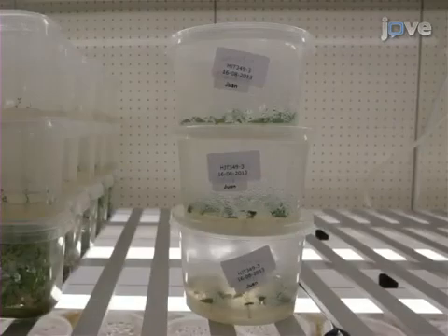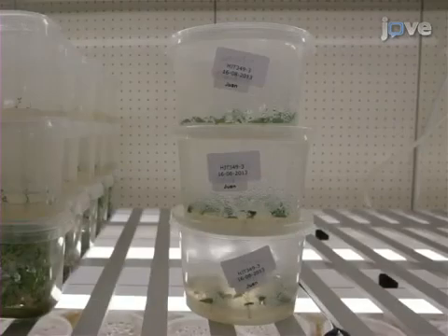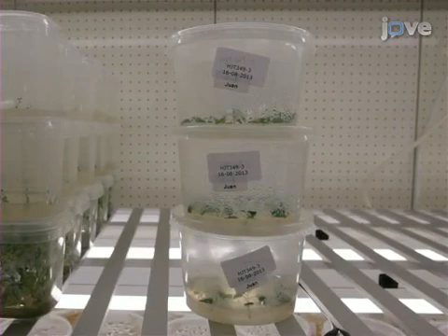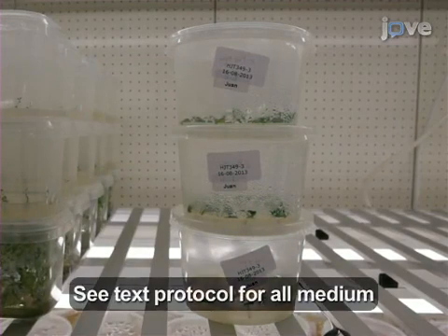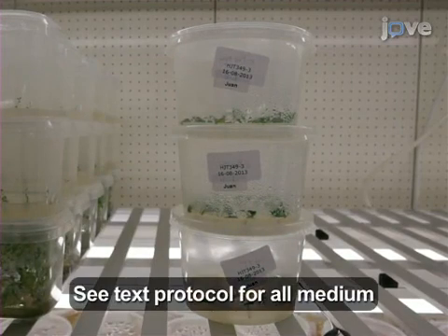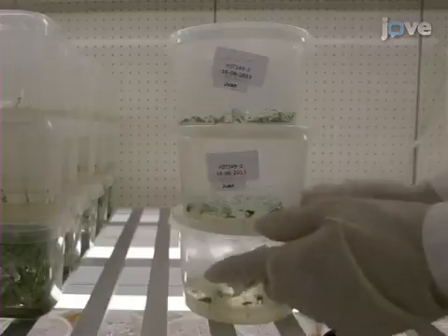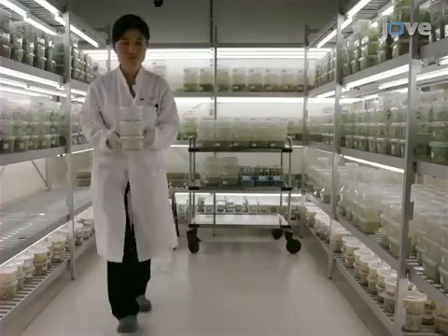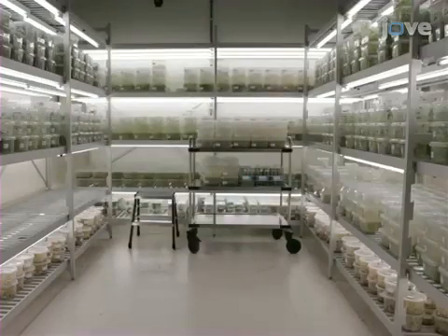To generate potato plants, maintain in vitro plantlets in sterile plastic jars containing Murashige and Skoog, or MS medium, in climate chambers at 18 degrees Celsius with a 16-hour/8-hour day-night regime for two weeks.